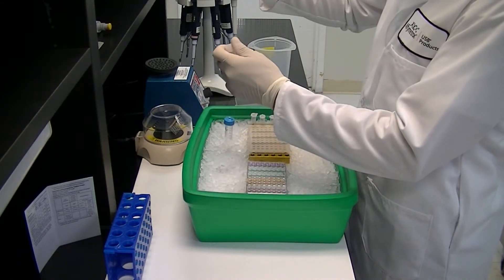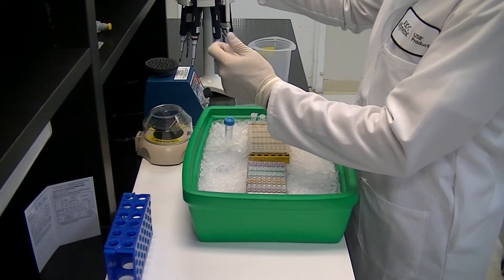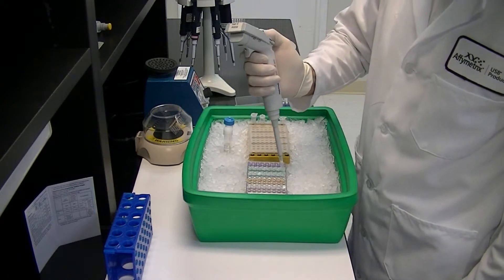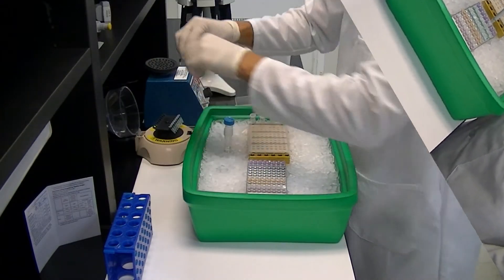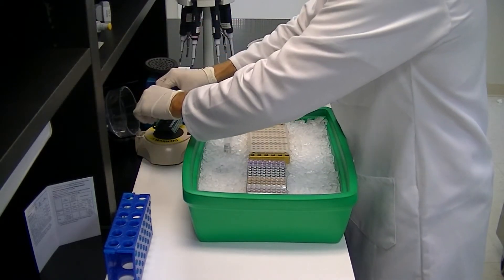Next, complete qPCR cocktails for each primer set and mix — in this case for the four different standard curves — by adding 2x master mix to the respective diluted primer sets. Mix the solutions well by vortexing and spin briefly to collect contents.